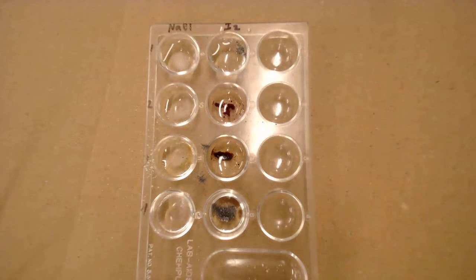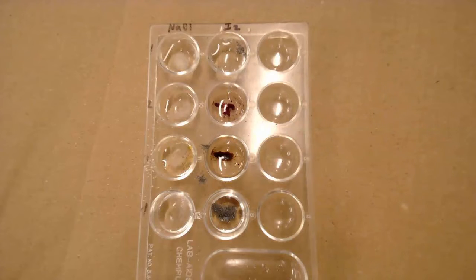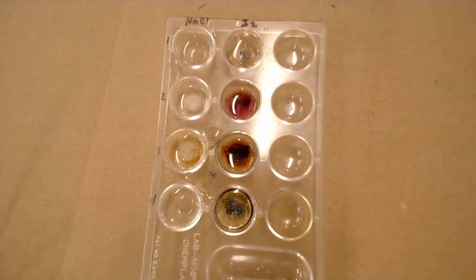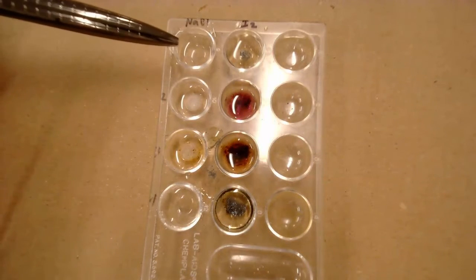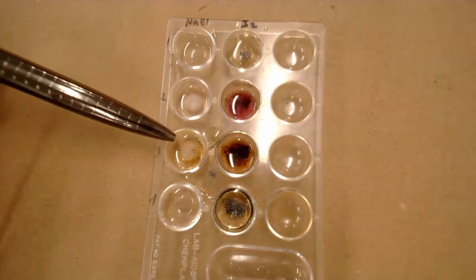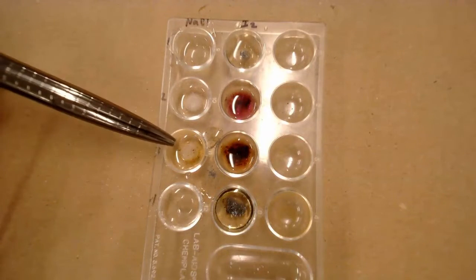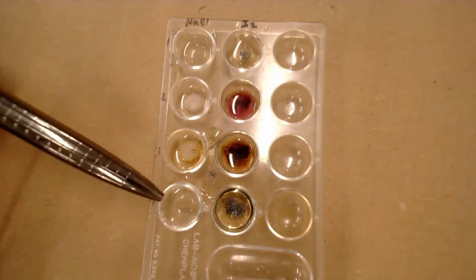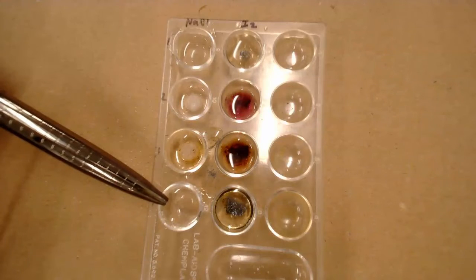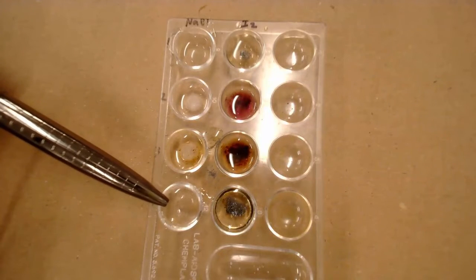Now we're going to stir these up, wait a couple of minutes, and check to see what our results look like. Here are our results. You can see in the first well the sodium chloride dissolved in the water — so that's soluble. But in the two oils, the sodium chloride is still there — those would be considered insoluble. And for the glycerin, you'll see that most or all of the salt is already dissolved, so that would be soluble.